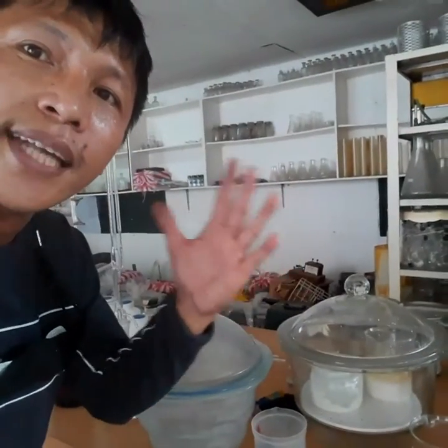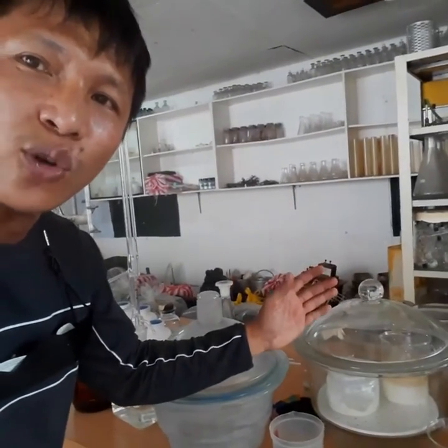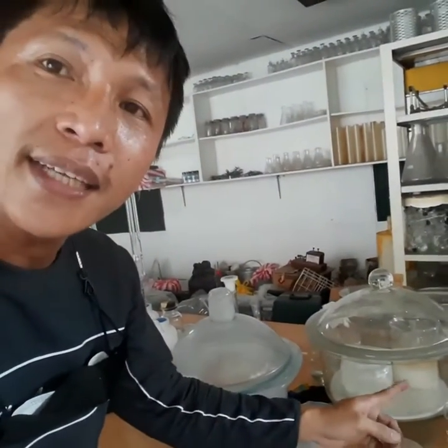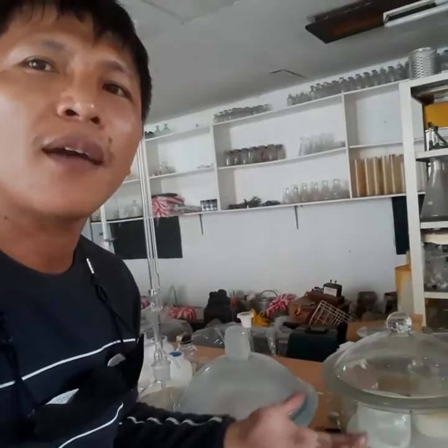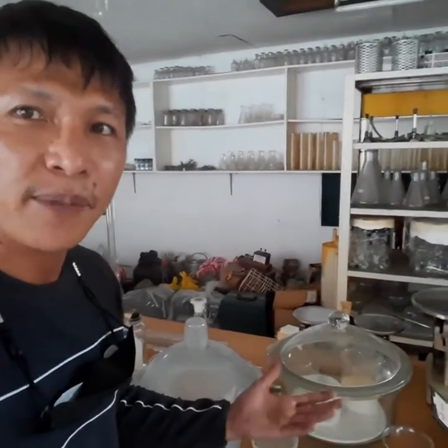It will suck that moisture so that whatever you put in your desiccator would not be contaminated by it, because the moisture was already taken off by the desiccant. That desiccant will also get full, so we have steps on how to handle that, or probably you can just buy a new set of desiccants.